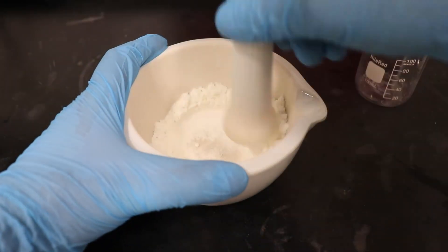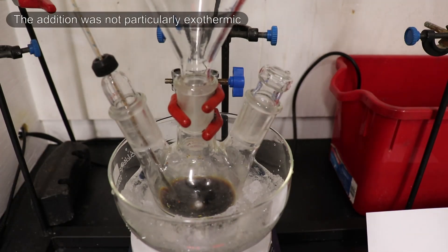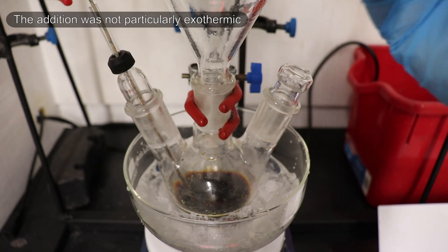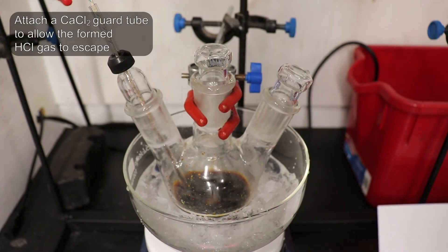The resulting powder was then slowly added into the aluminum trichloride and nitrobenzene solution while maintaining the temperature below 10 degrees Celsius.